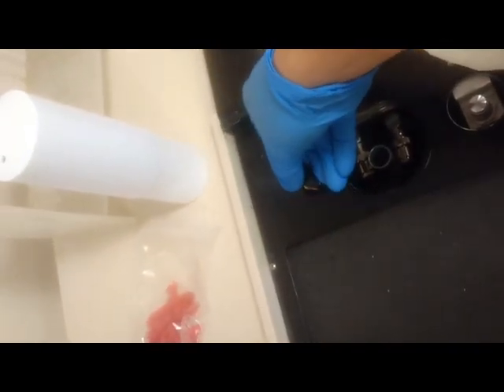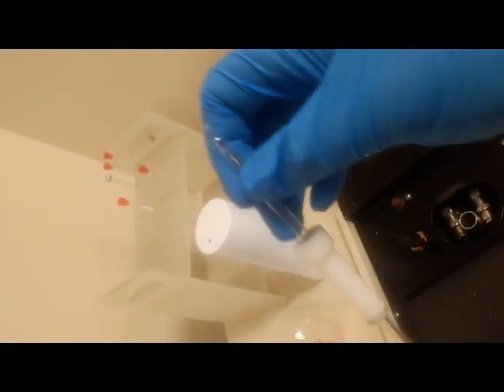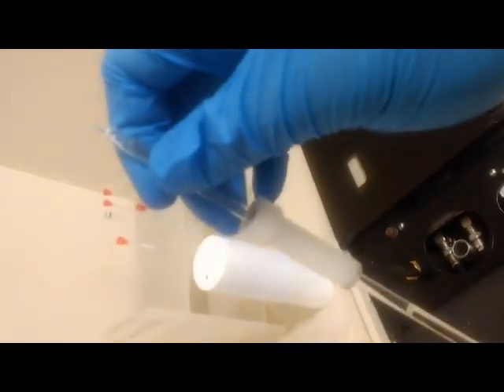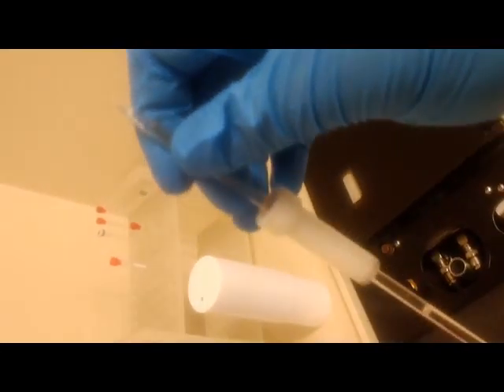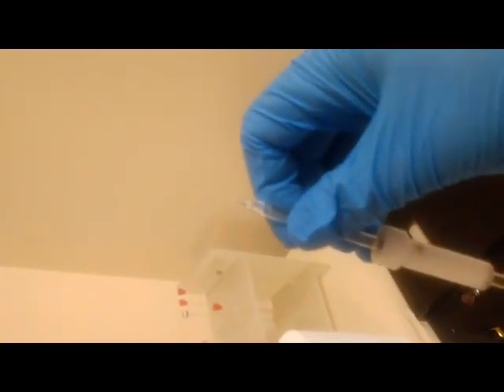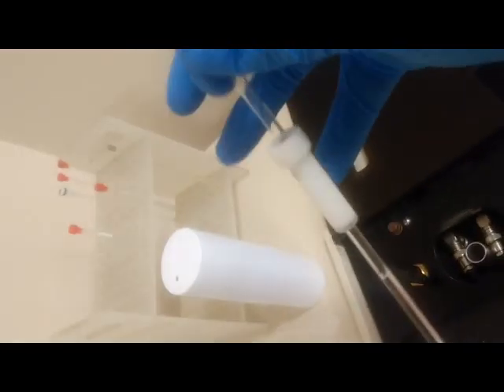After you're done with the NMR acquisition, you will want to take your sample out. And then, of course, you can take your NMR sample tube out of the holder and take it back to your bench. Now, if you're the last person, you will want to put some sort of a sample tube back into the NMR machine. The magnet should always have an NMR sample in it. So here's a pre-made standard solution. I'm going to put that back in. But if there's people waiting after you, you can just hand them this sample holder.